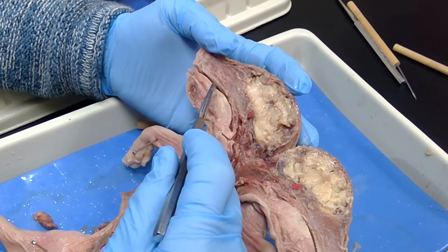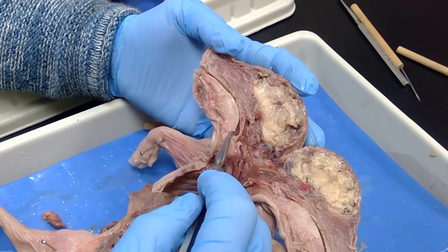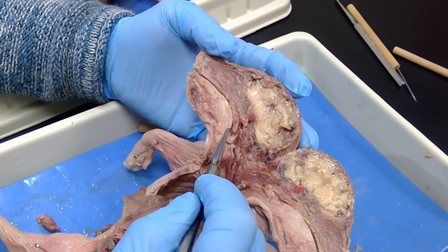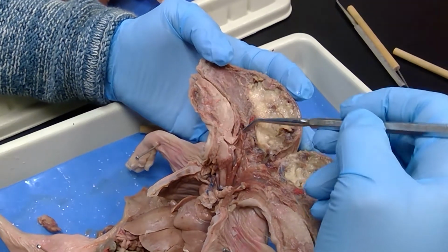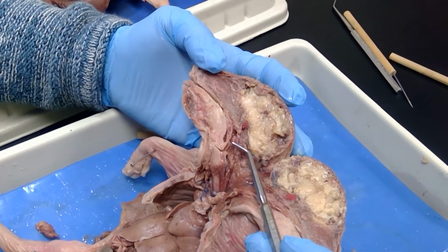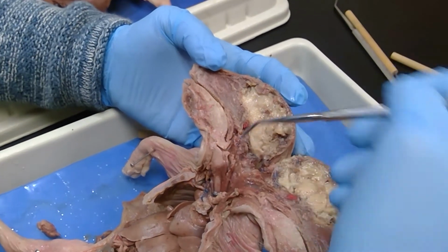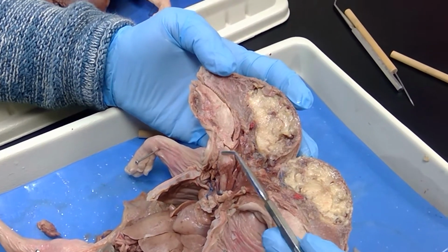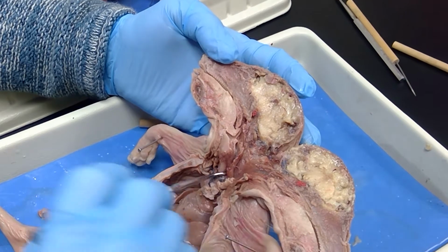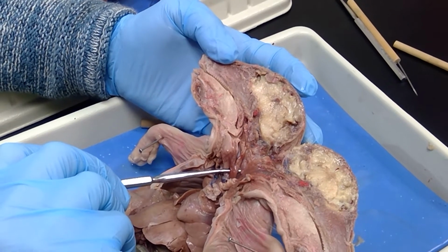The food would go from the oral cavity. You would swallow it. It would go down this direction, and the tongue movements would move this epiglottis right down. So this right here is the epiglottis. And I really like that picture right there. See, it's curved right there. Air would go through this right here. And it's cut right there, but it would go through that and go into the larynx. This enlarged structure here is the larynx. This is the trachea. And this smooth structure posterior to the trachea is the esophagus.